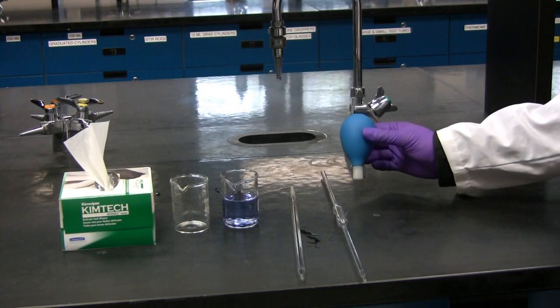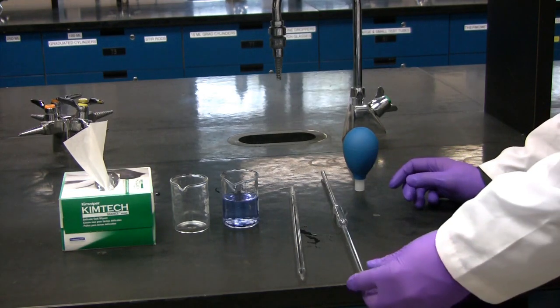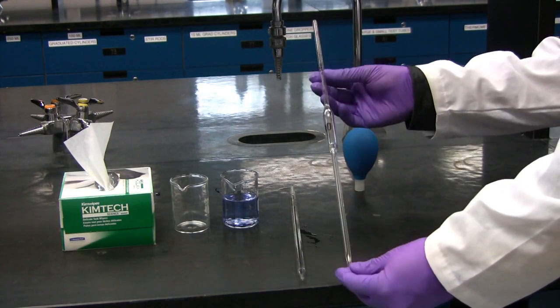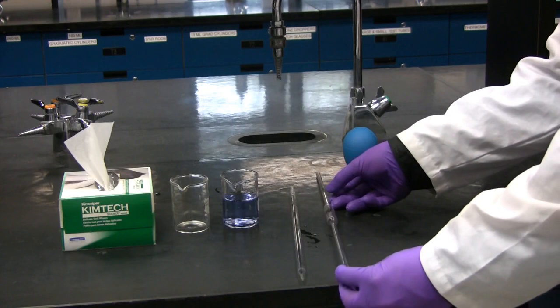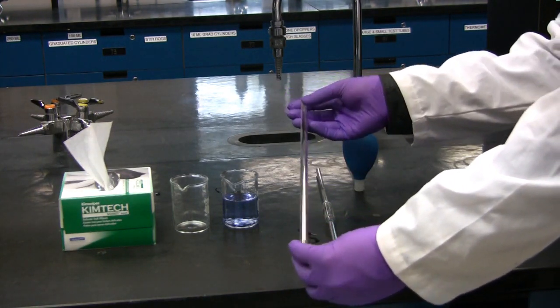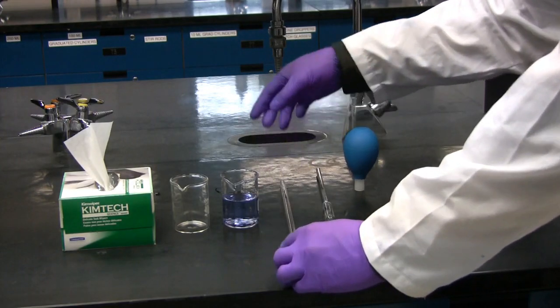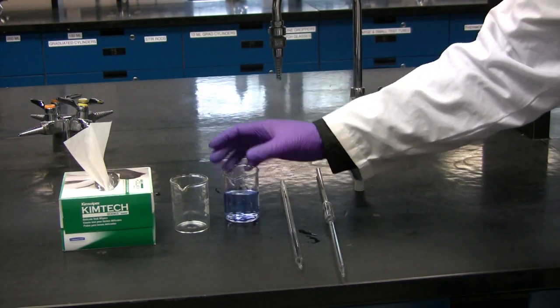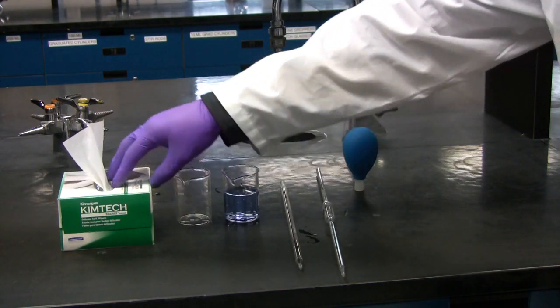You will require a pipette bulb, a volumetric pipette or a graduated pipette, the solution you will be pipetting, a waste beaker, as well as kim wipes.